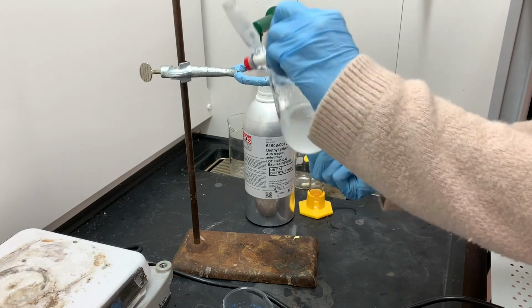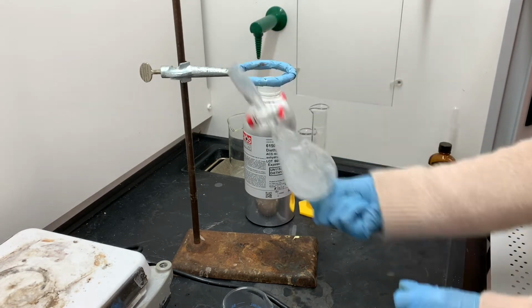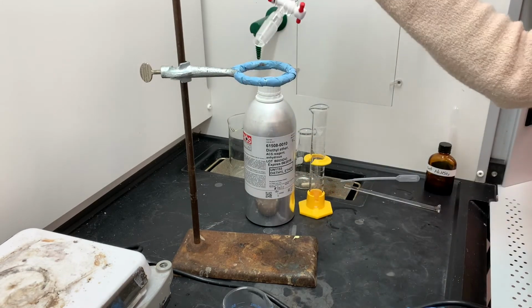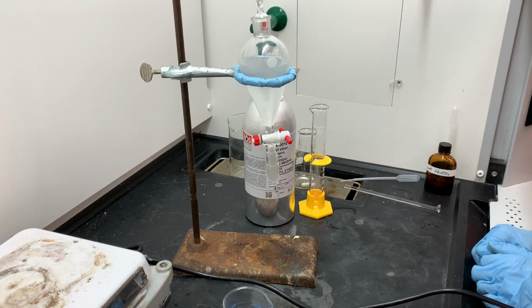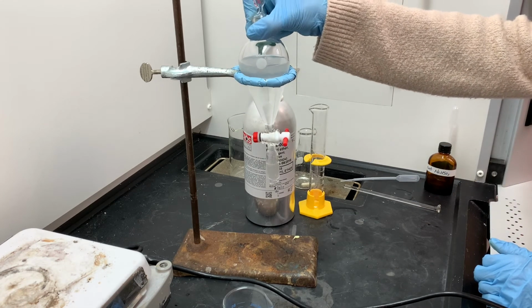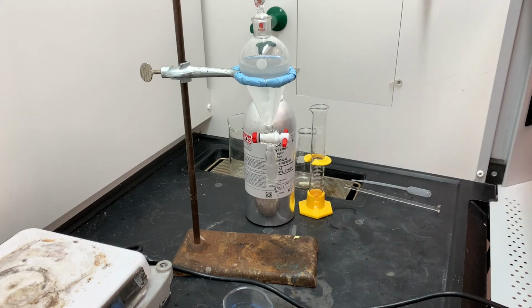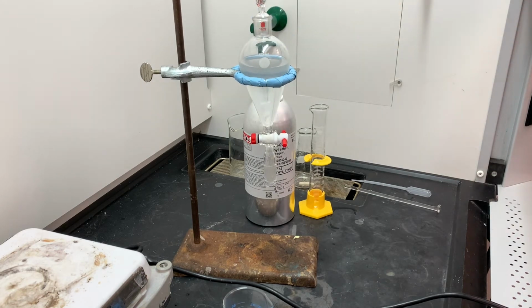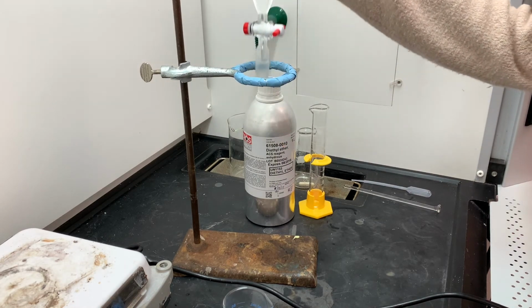So this time as I'm shaking, this is actually hopefully an extraction. My product is hopefully moving out of the water layer into the ether layer. And I'm just going to let it sit, let the ether and the water kind of separate from each other. If you can see, it's really hard to tell the difference between the ether layer and the aqueous layer, but that almost kind of cloudy stripe around the very top of the separatory funnel, that's the ether layer. With a little bit of time, that ether layer will clear up.